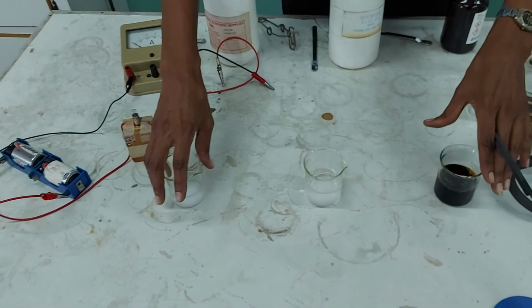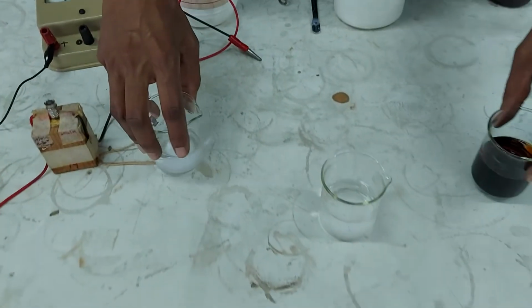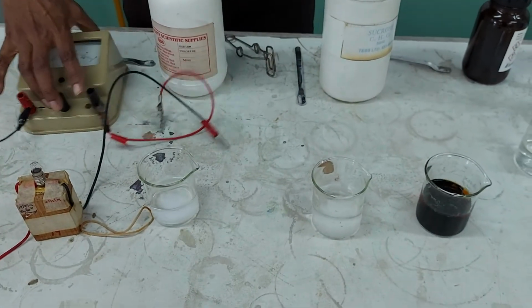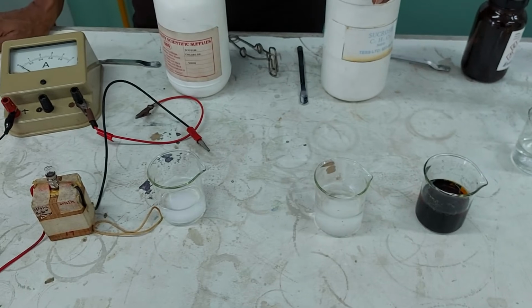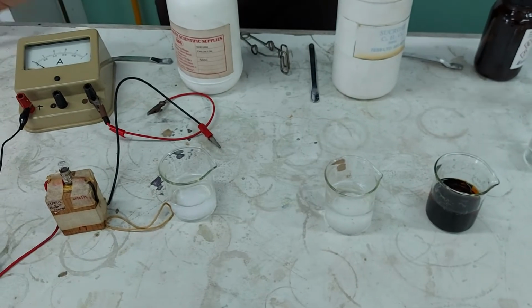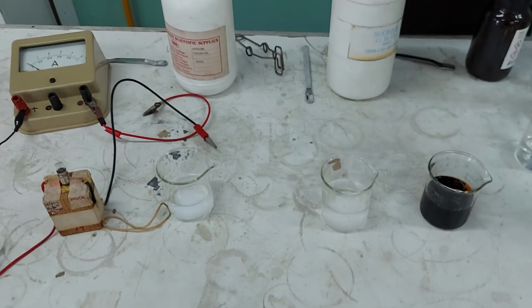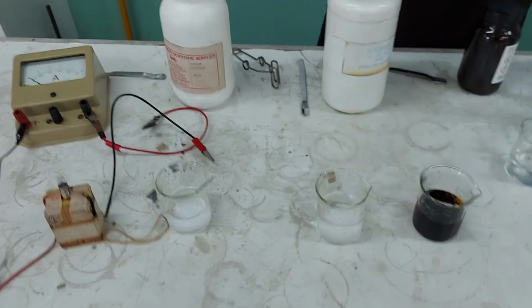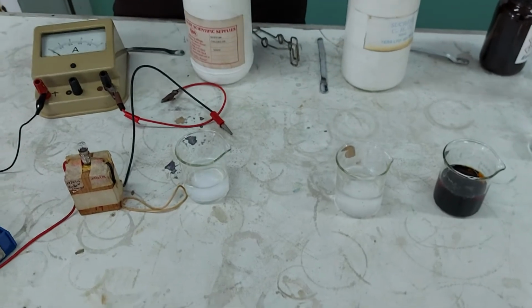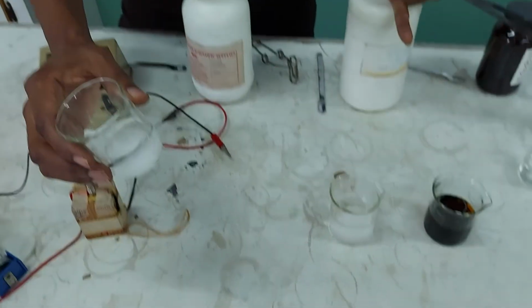Next, we're going to go on to looking at what happens with alcohol. Our choice of alcohol today is ethanol. Ethanol, as you know, is a covalent substance. Okay? And being covalent, there are certain characteristics that would be involved in what can dissolve in it. So let's take a look.